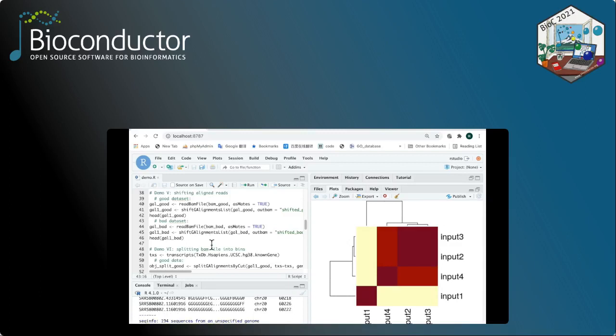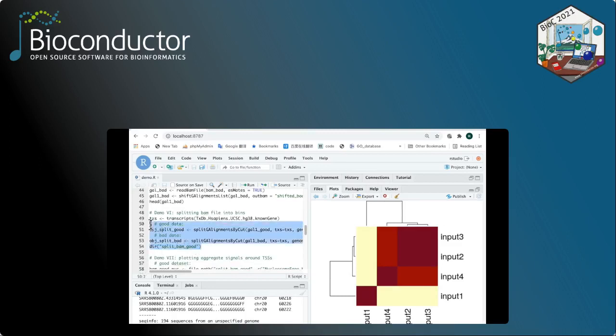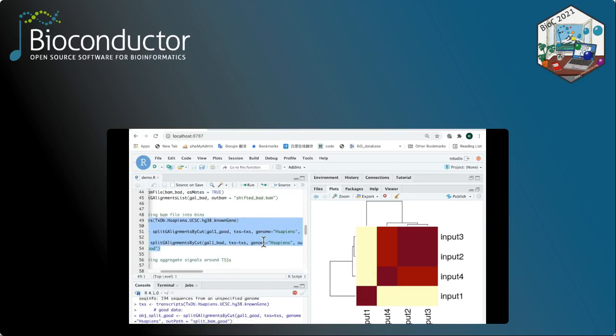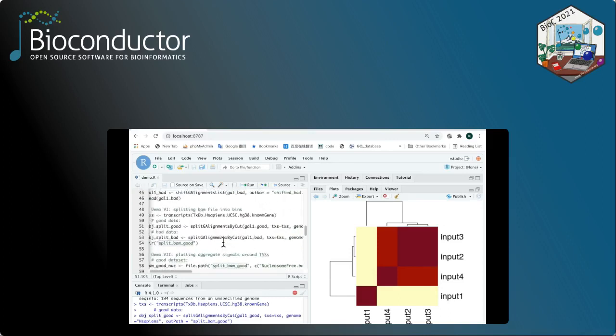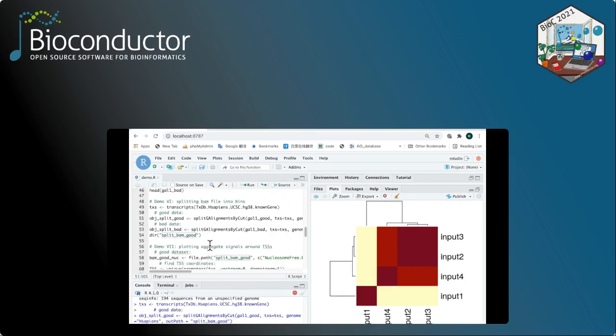Okay, now demonstration 5 is finished. We can move on to split the BAM files into bins. And to this end, you can use the function called splitGAlignmentsByCut. The result will be saved into the outpath specified here. Again, this function may take a little bit longer. We also have to be patient. Okay, now all the BAM files are successfully split into different bins.